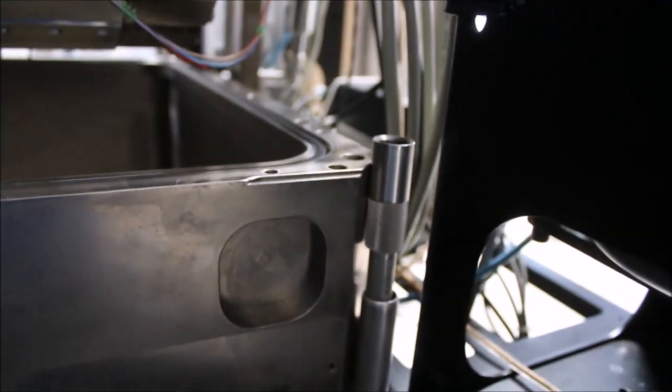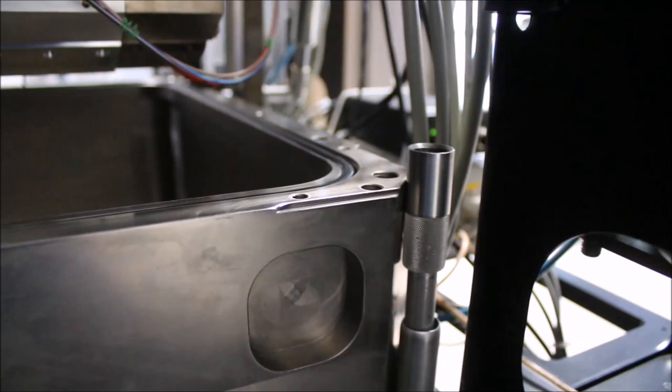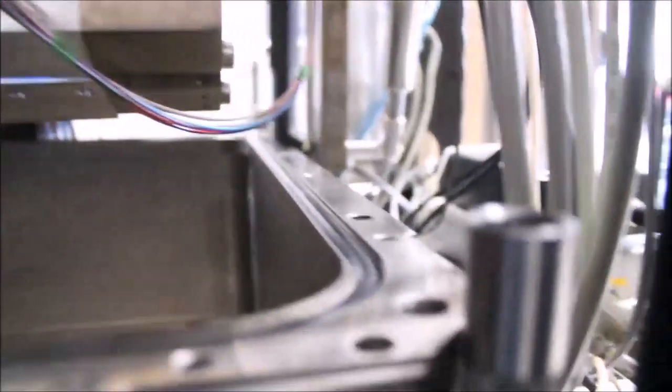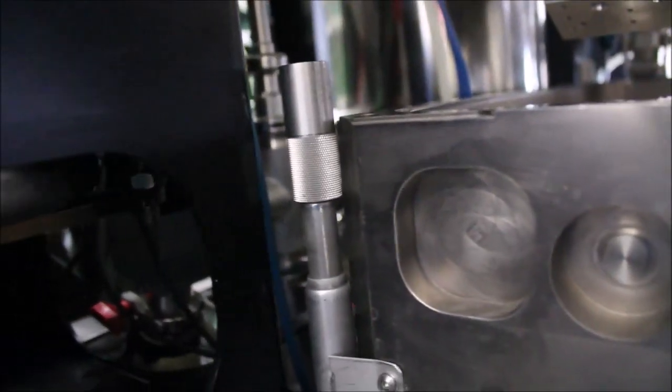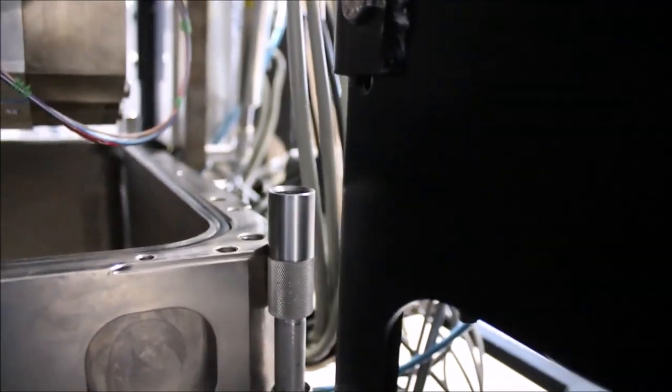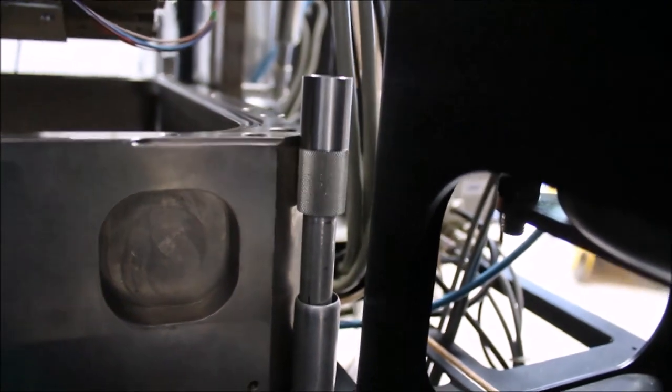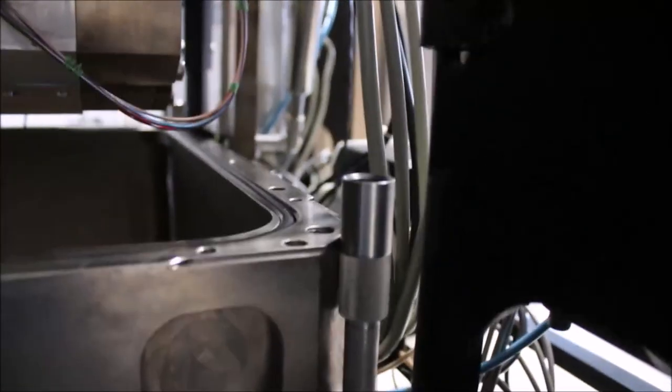The sump is now in place. What's important to do now is we have to let the four little antennae, one on each corner of the sump, extend them back up. We have to pay very close attention that each one is extending. These little antennae are spring-loaded and are supposed to keep a constant tension on the lift cables. But if there's something wrong, if there's some friction in there, then they won't. Then the little cable will get bound up in the internal winch and that'll make a big service issue on the sump.